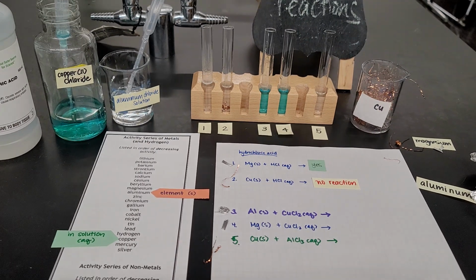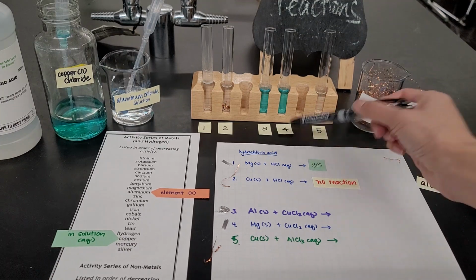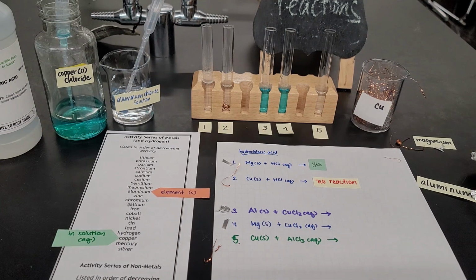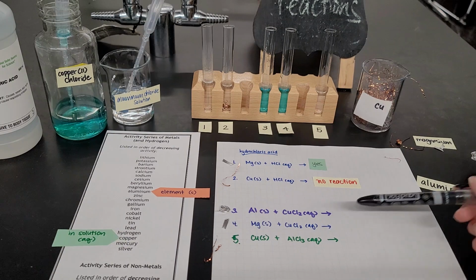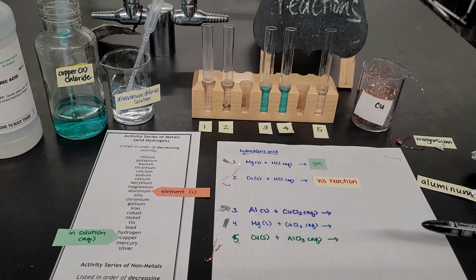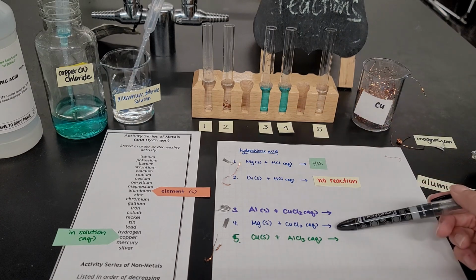Let's move on now to reaction 3 and reaction 4. In test tube 3 and test tube 4, I have copper 2 chloride that we used before in previous labs, also with the flame test labs and the types of reaction lab. I already showed you reaction number 3 in the types of reactions lab, but let me show you one more time. Both of these test tubes have copper 2 chloride.